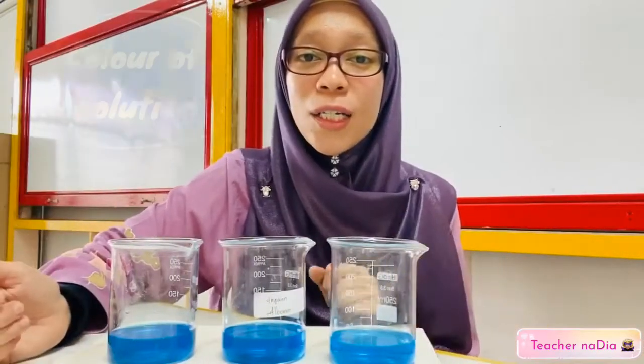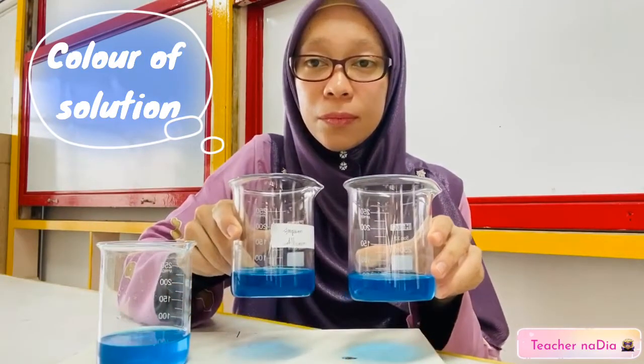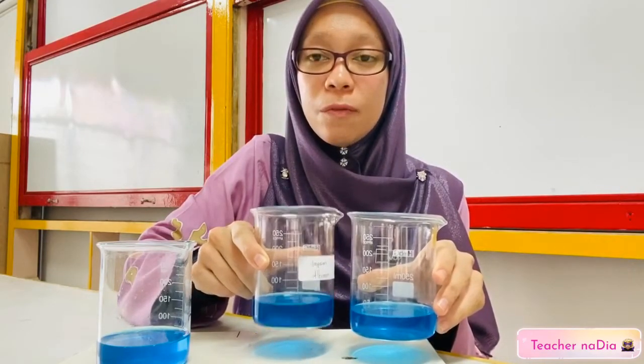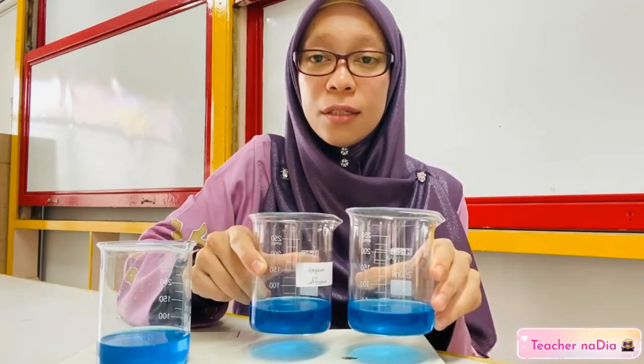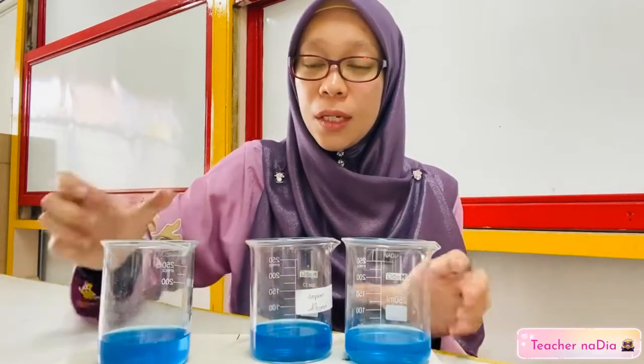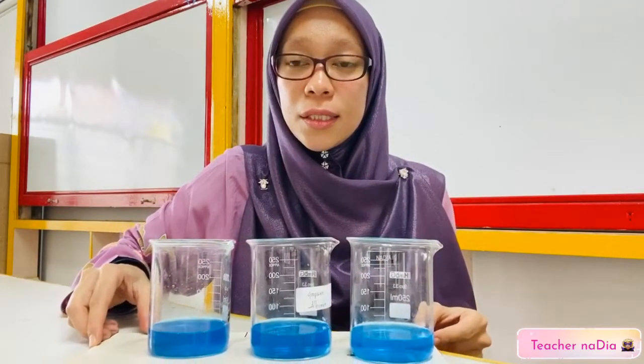What about the color of the solution? If you compare, can you see? The color of Q is darker compared to P. And then for R, if you can see, it is the darkest.